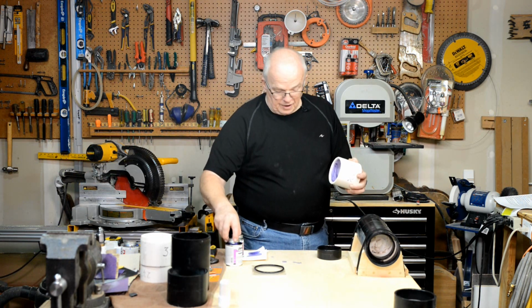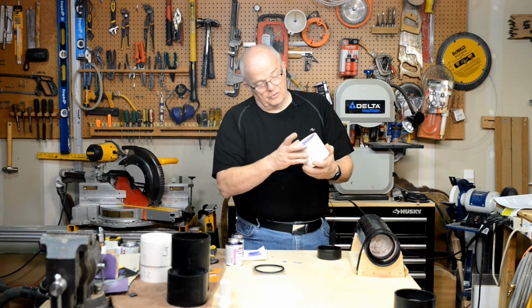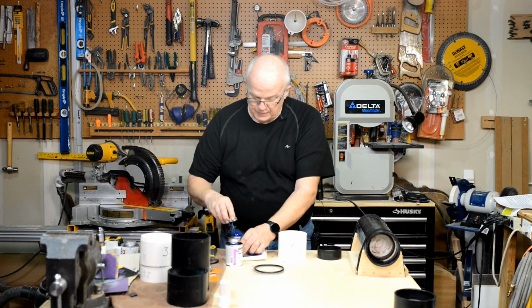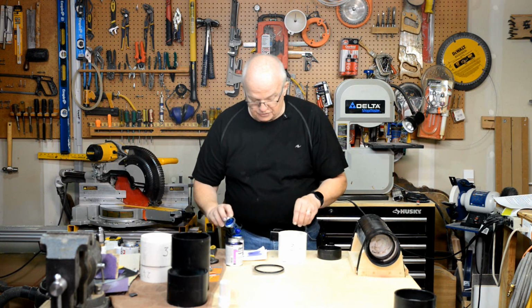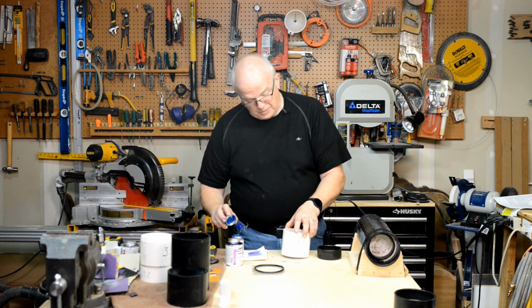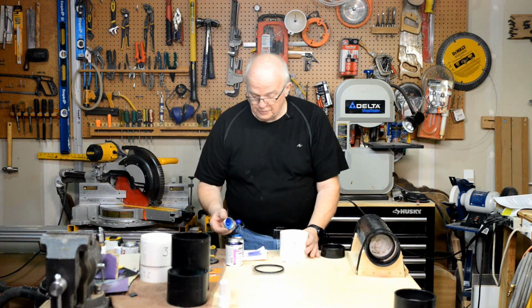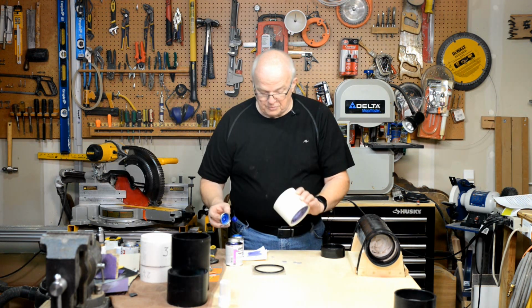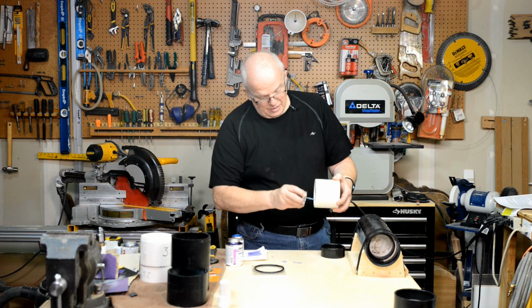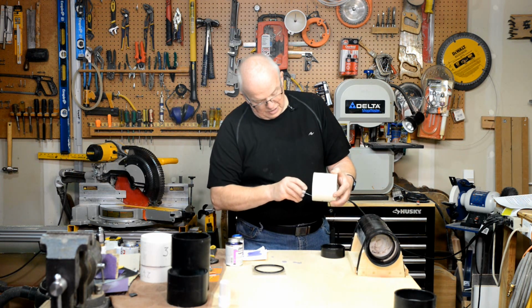And that's all you need there. Okay, I did get it a little close there, but I didn't get it up over the edge, which is okay. Now, you're going to want to take your glue or your cement, and you're going to want to be fairly liberal with this cement because you do want squeeze out on the inside. You don't want squeeze out along this edge, but along this back edge here, you do want it to squeeze out. So making sure that it's not going to drip on me, I'll put it inside of here. Be careful to keep it away from that edge.